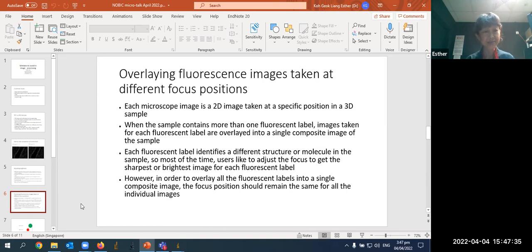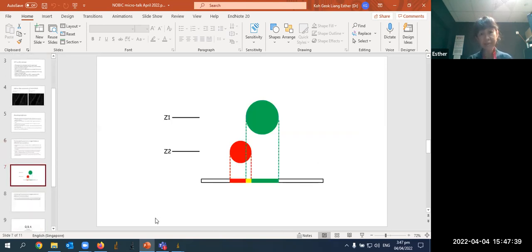Now, this is a mistake, because let me just show it to you here. Let's say you have a sample with a green blob, a green vesicle maybe, and a red vesicle. We're looking sideways onto the sample, so the green is in a position that's above the red structure. So when you focus on green, the red will look out of focus. If you focus on red, the green will look out of focus. So most people, especially beginners in microscopy, want everything to be in focus when they overlay the image. But if they do that, they take one image at Z1, they take one image at Z2, then they overlay. The person who looks at the merged image will think, oh, the green and the red are at the same level, which is not the truth.